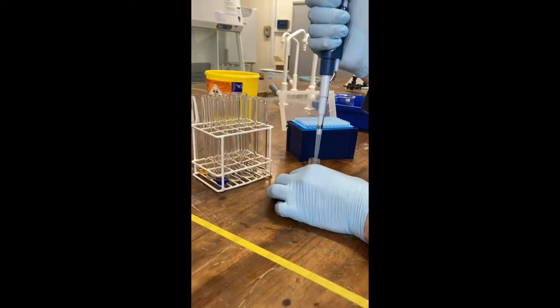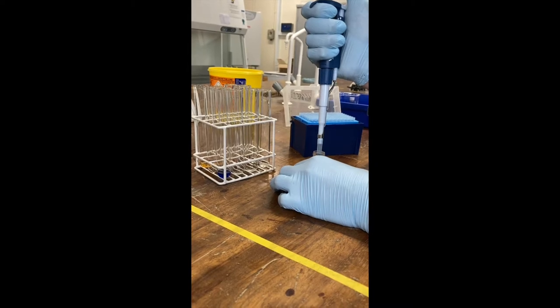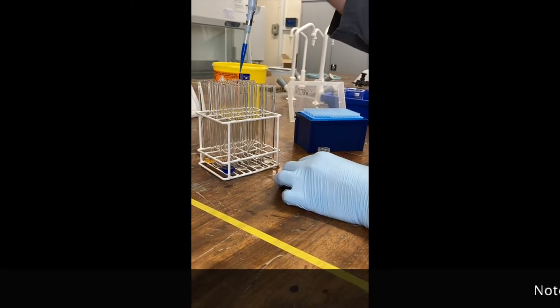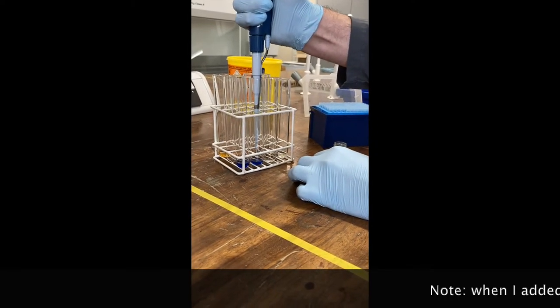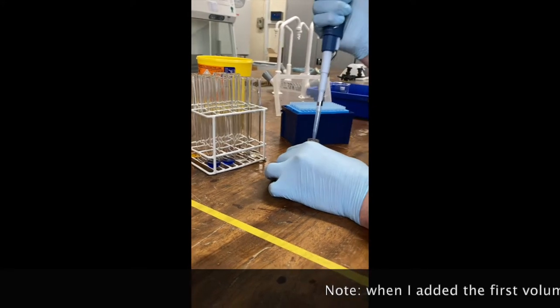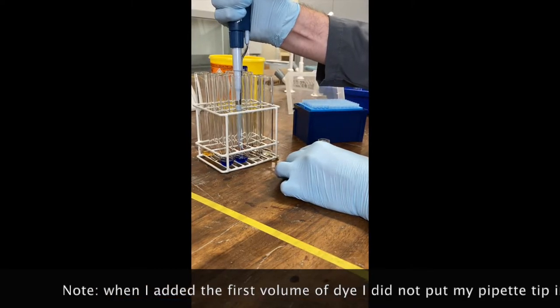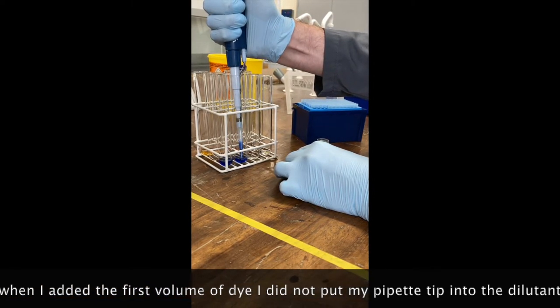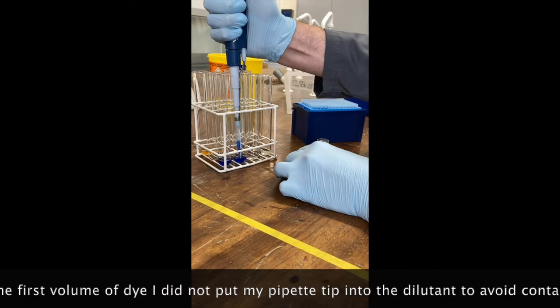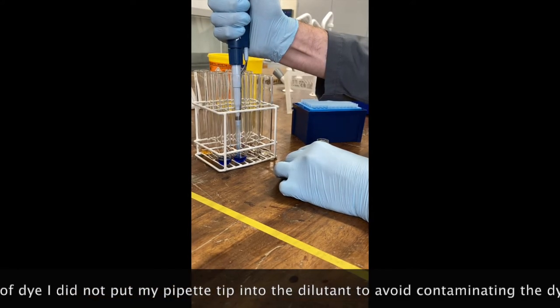So I'm going to set it to 750, and then pipette that twice. Relock it, first stop, into my solution, pipette up slowly, add to my first tube, go into the second stop, and repeat. And then what you want to do is just pipette up and down a few times, gently, just to make sure you properly mix your solution.